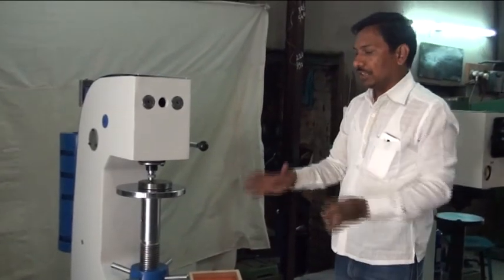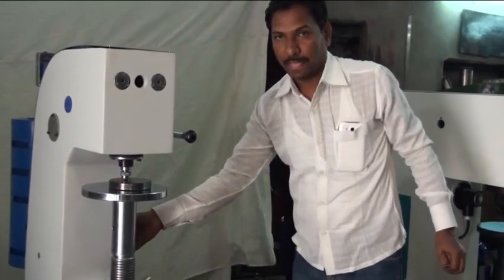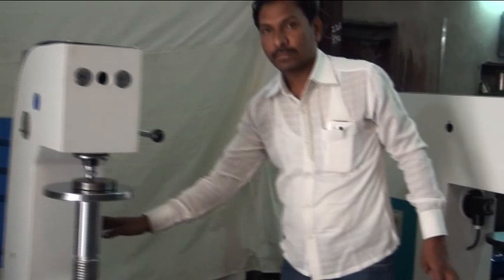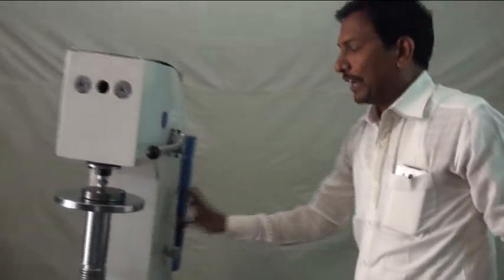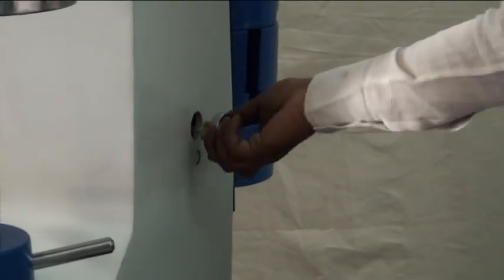If this is the position of taking the load, then adjust the speed here. How much speed we are getting here to adjust the load, rotating this side clockwise or anticlockwise and adjust the speed here.